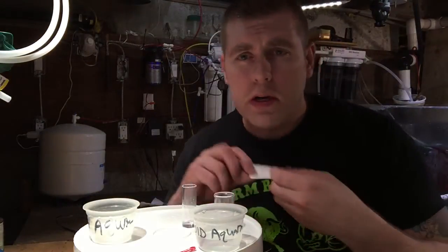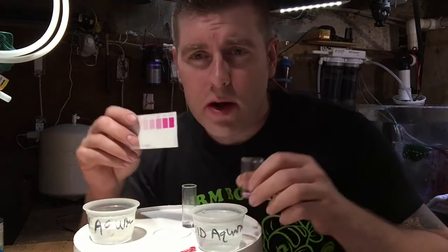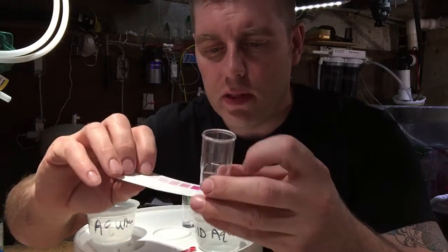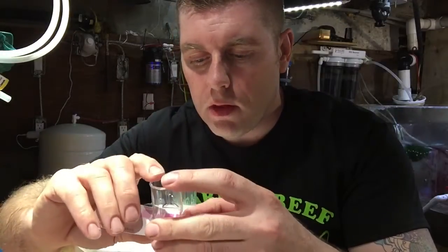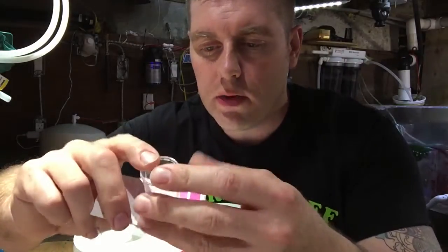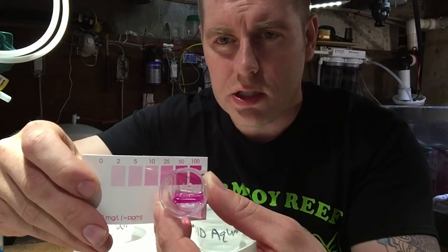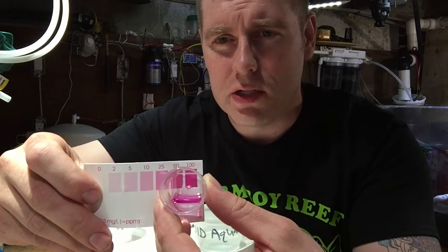Now what we have to do is test against the chart. I'm going to take the old aquarium water sample and show you what you do not want in your tank. The chart goes from zero to a hundred parts per million. Looking at this old water — she's at a hundred. That's definitely in the danger zone; things aren't looking too good in that tank.